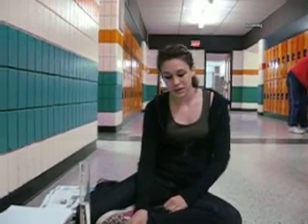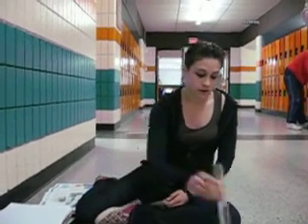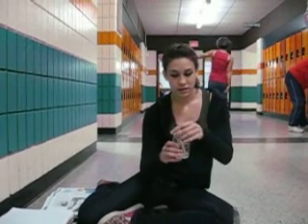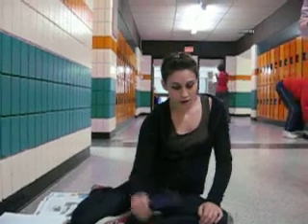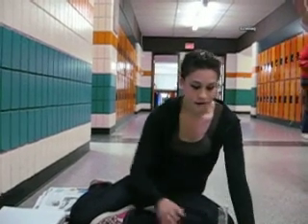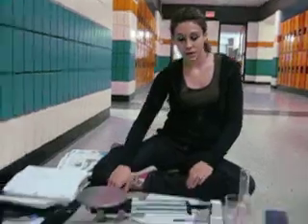Today we are doing a lab on density of liquids. What you'll need is a beaker, an eyedropper, a pencil, a graduated cylinder, a calculator, and a triple beam balance.